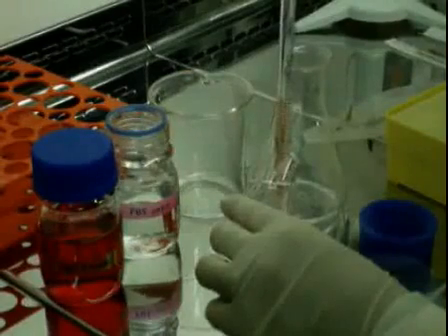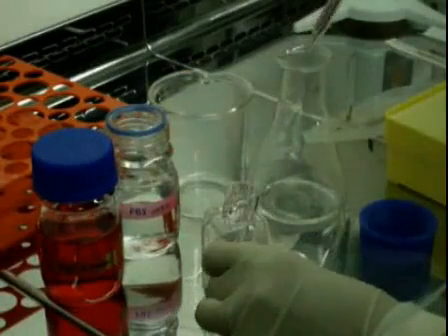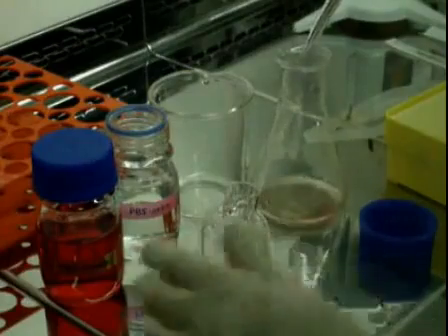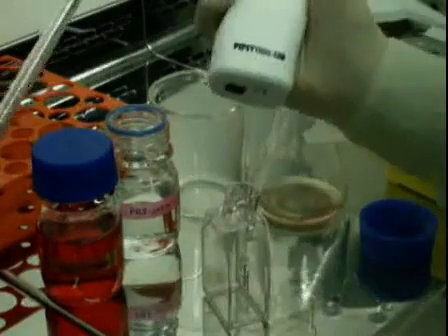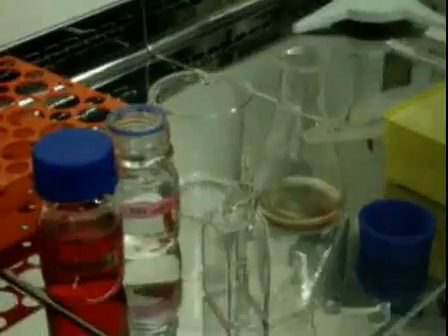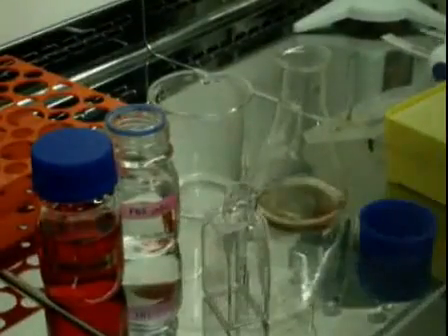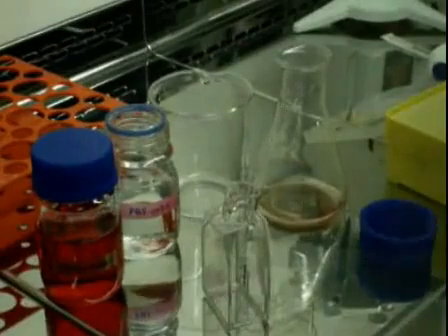First, I remove the medium. Then I am going to wash the cells with PBS. But first, I change the pipette to avoid the contamination of PBS.